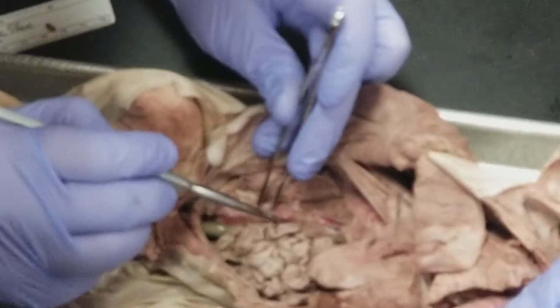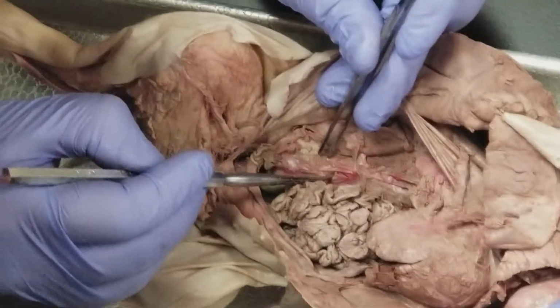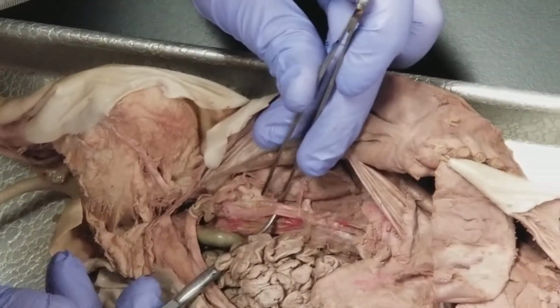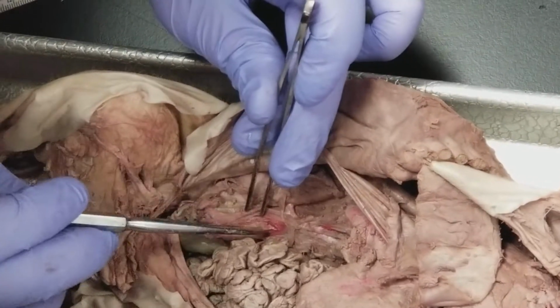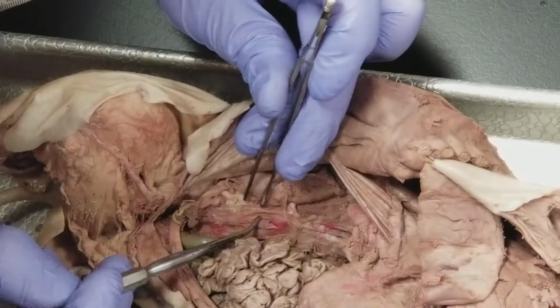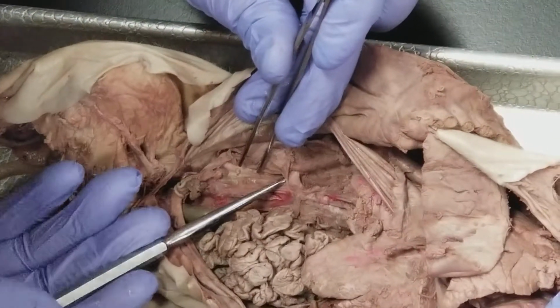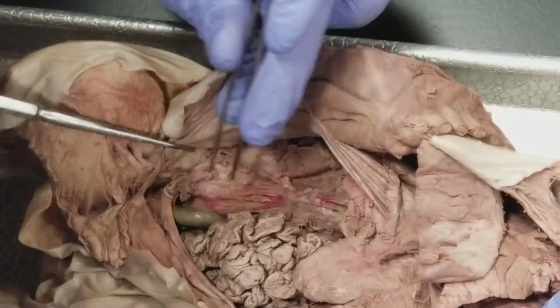It's going to have a much thicker connective tissue covering than our vena cava, which didn't get injected, so it's completely flat. But you can see how nice and thin the walls are. If this guy was flat, it wouldn't be nearly so thin. So this is our inferior vena cava. So again, that was renal artery and vein there.